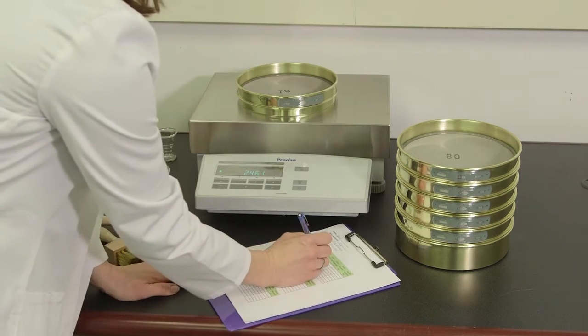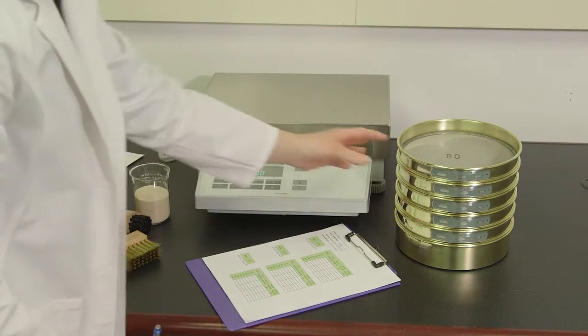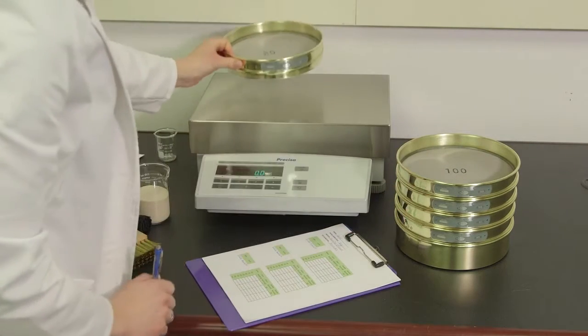Before testing begins, be sure your sieves are clean and dry. Weigh and record the tare weights of each sieve and the pan.